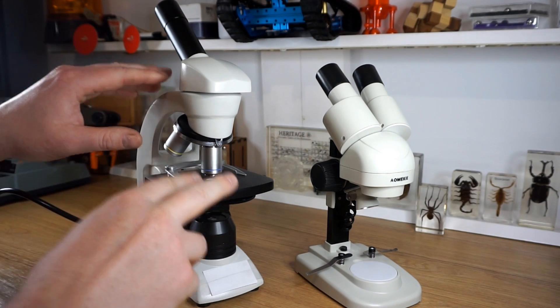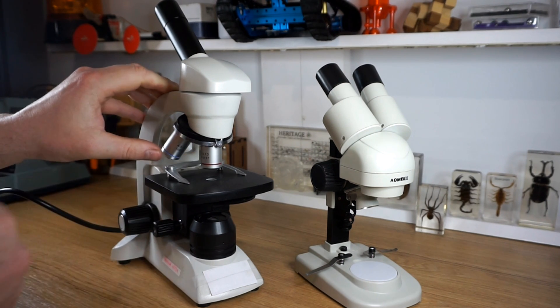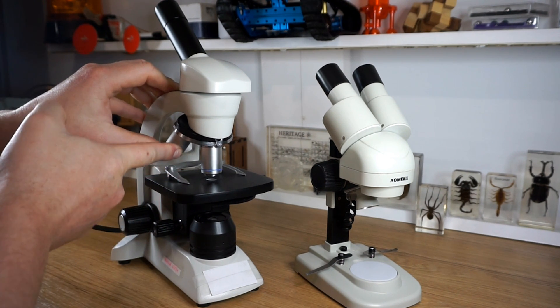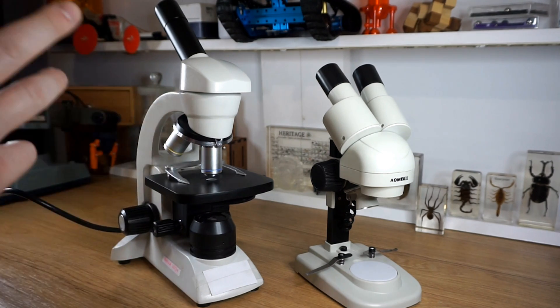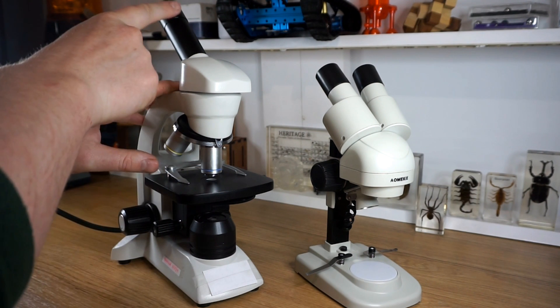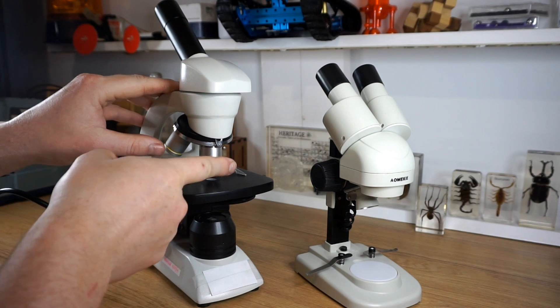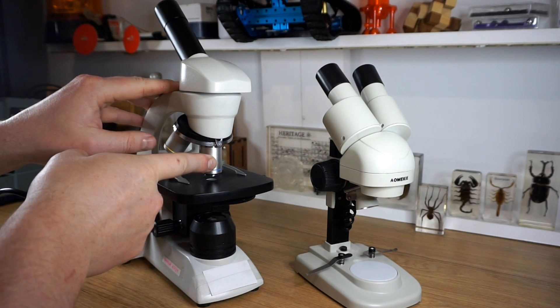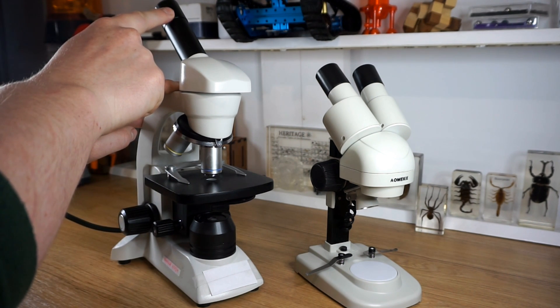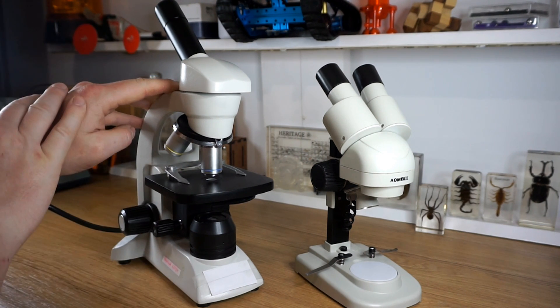A key feature of the compound microscope is that it has these objective lenses that you can switch between. We have the weakest one, which is 4x magnification, then 10x magnification, and 40x magnification is our strongest. But the total magnification of this microscope is the objective lens multiplied by the ocular lens in the eyepiece, which is 10x magnification. So in this case, 40 times 10 gives us 400x magnification.